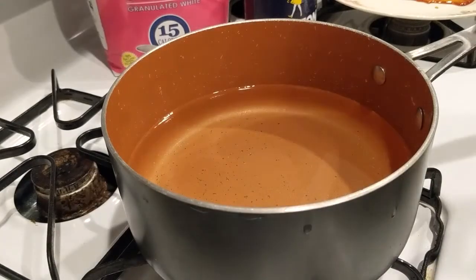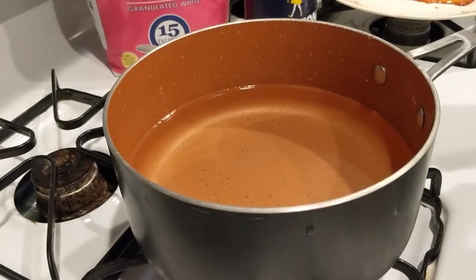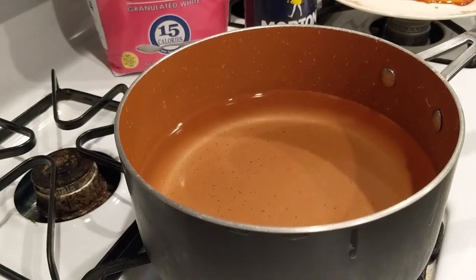Alright, so in this video, we're going to be looking at the boiling point of water. And it actually takes a really long time to boil water, so I'm going to start heating it up already. So we're going to boil water, and theoretically it should boil at 100 degrees Celsius.